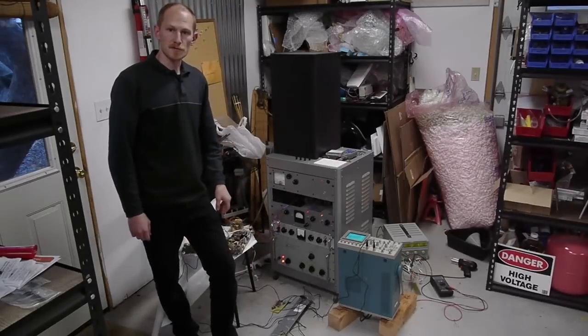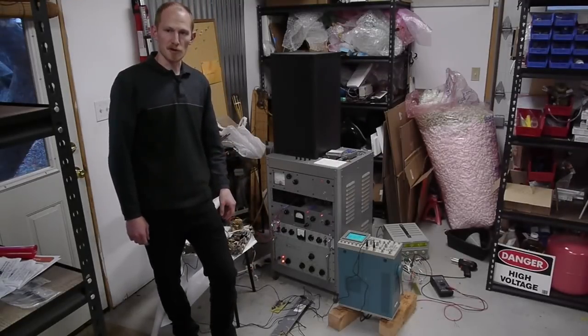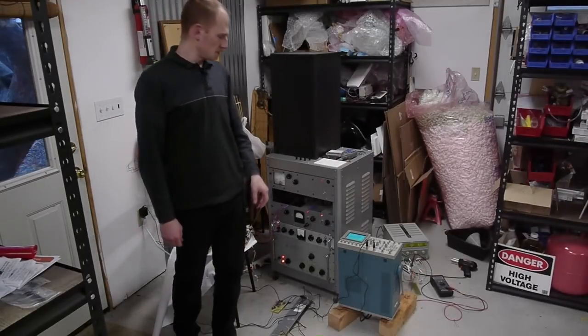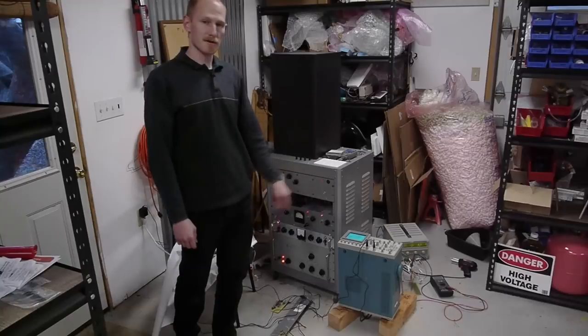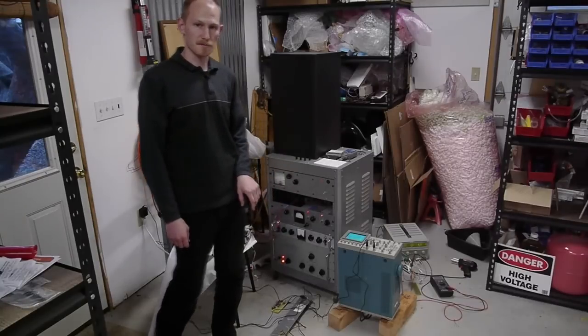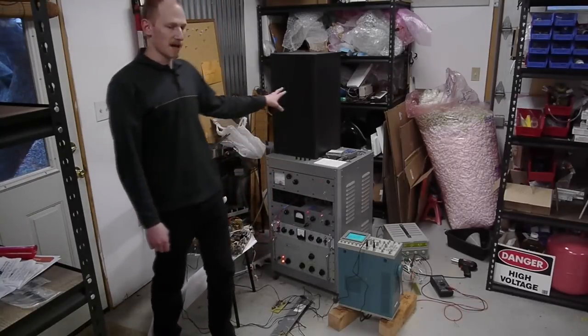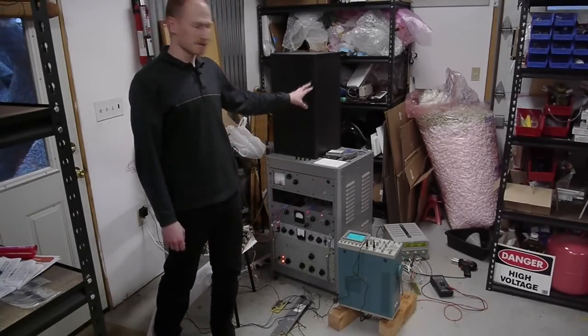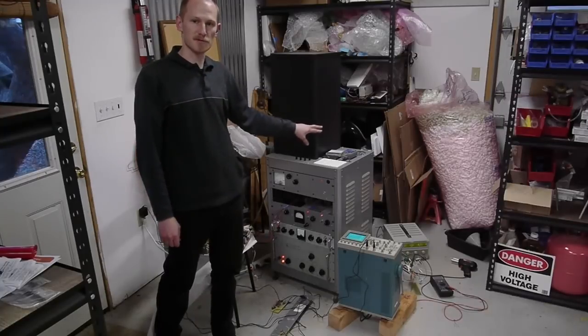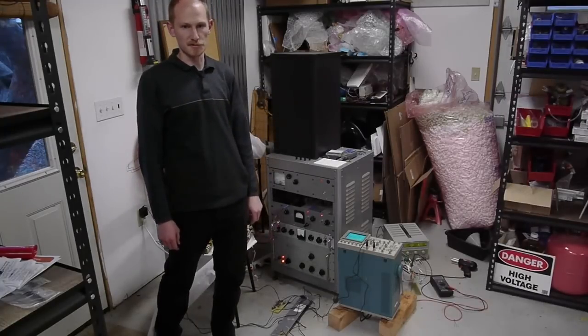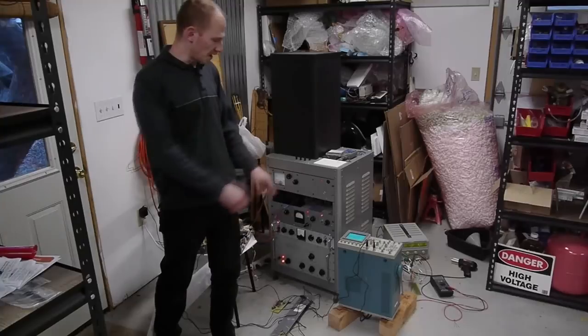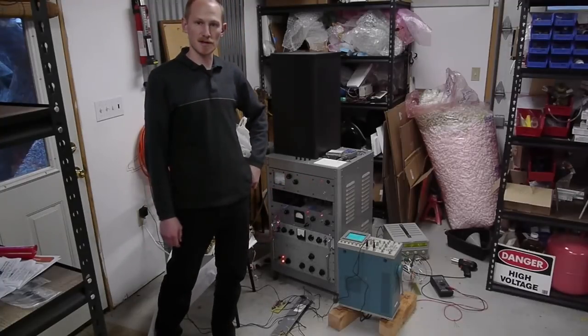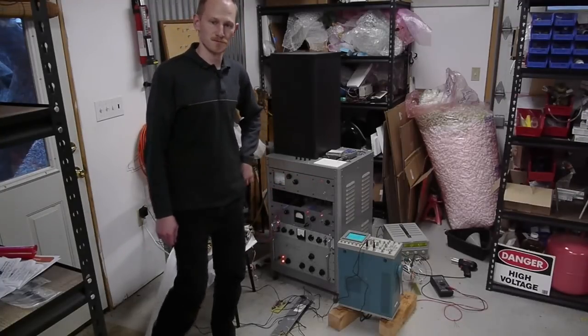Okay, the diffusion pump is running. Hopefully you can hear me over the cooling fan noise. The oscilloscope is generating an image from the microscope. Since I'm using a glass bell jar, I have to have this light-tight shield to keep stray light away from the photomultiplier tube. I'm going to dim the room lights and zoom the camera in on the oscilloscope display and then describe what's going on.